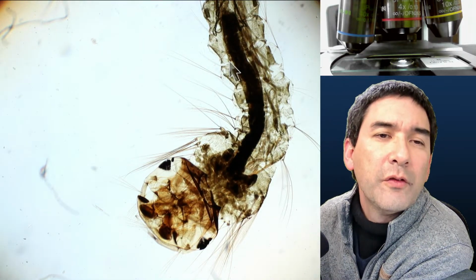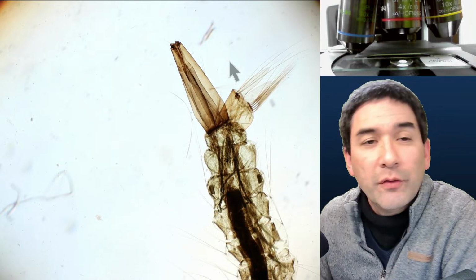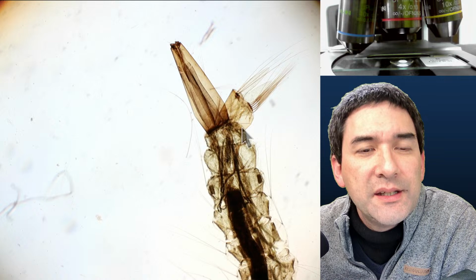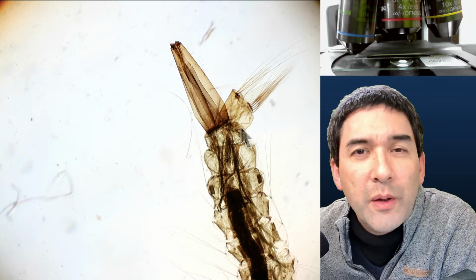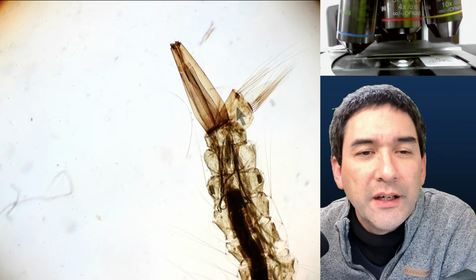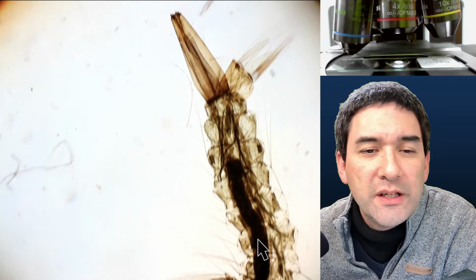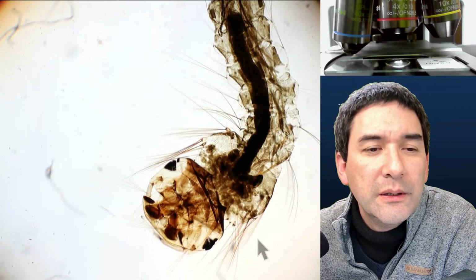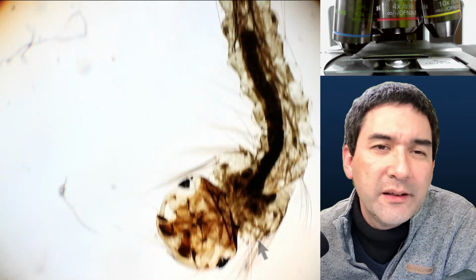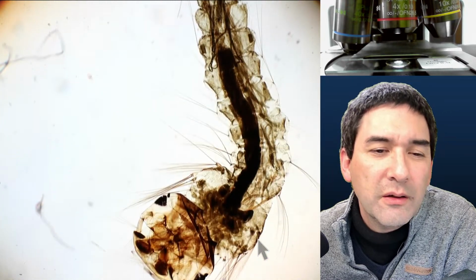Okay, that's the larva of a mosquito. And here on the back, this structure, what you see over here, that is the breathing organ. So basically what they do is they swim to the surface of the water, they stick out the back part here for breathing, and then the rest of the body is essentially submerged in water. Honestly, I think that when they're alive, they look a little more interesting.